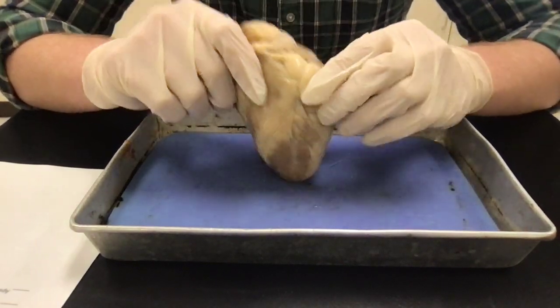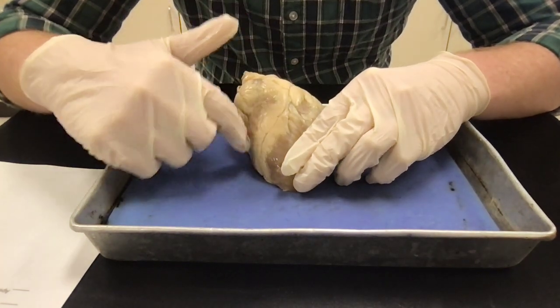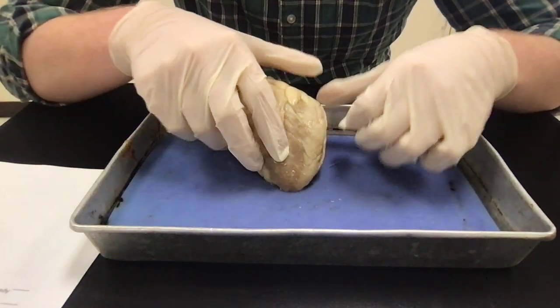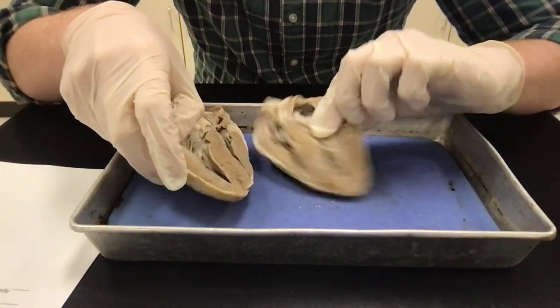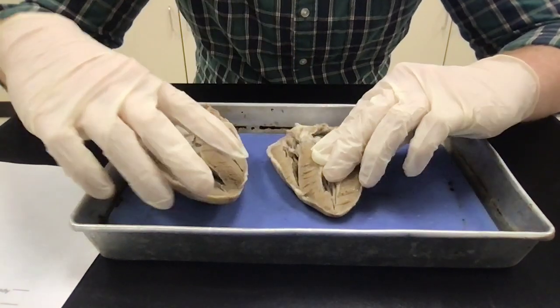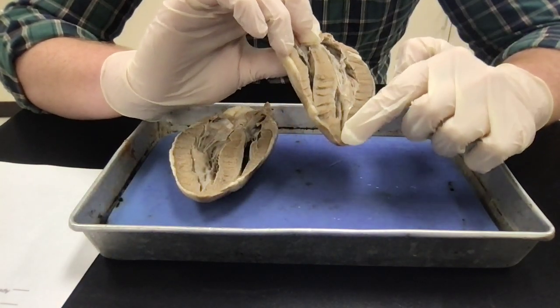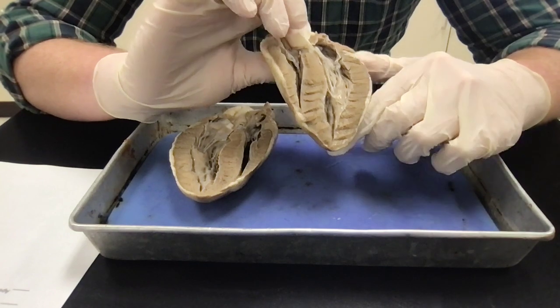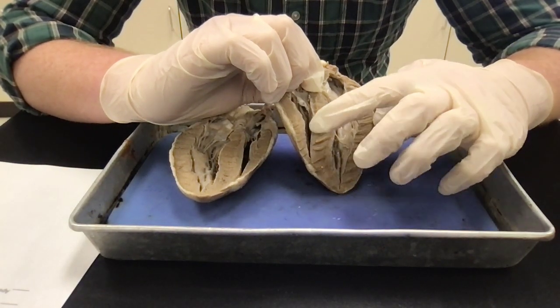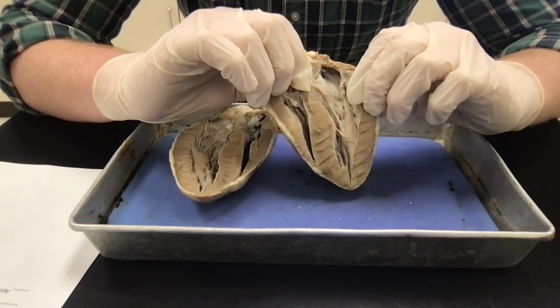You can tell as far as sides of the heart, this right here is going to be my right side of the heart, and then this side is going to be my left side of the heart. When we open up, you can actually see this will be my right chambers, and this will be my left chambers, okay? You can always tell this is because the walls on the left side of the heart are going to be a lot thicker because the heart has to pump blood to all parts of the body, which causes these muscles to be quite a bit bigger, making the left side of the heart larger.